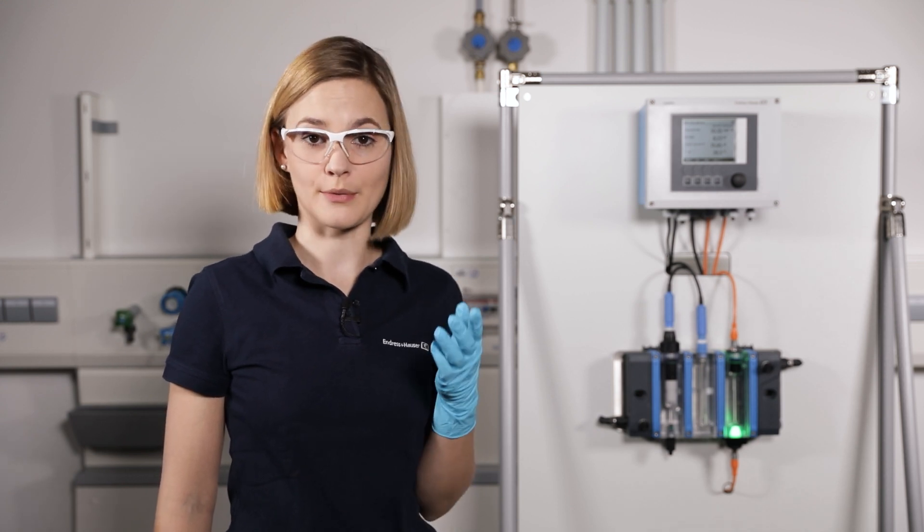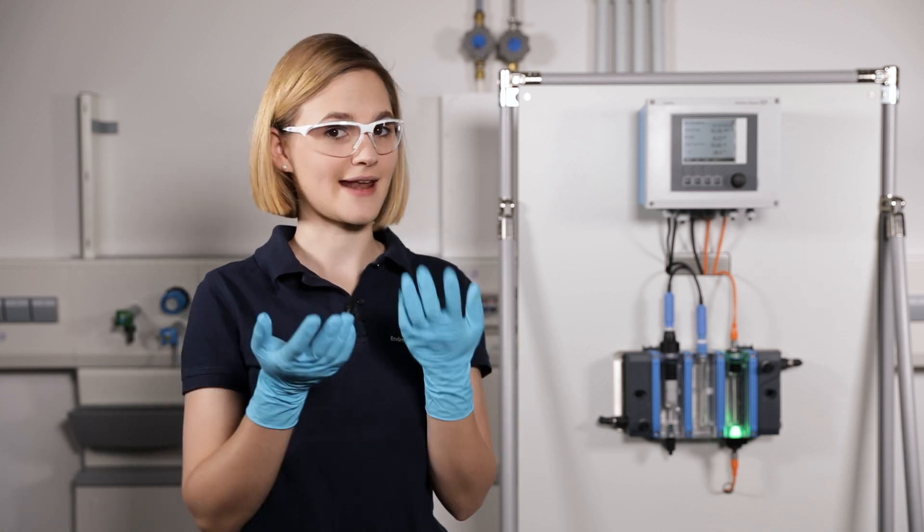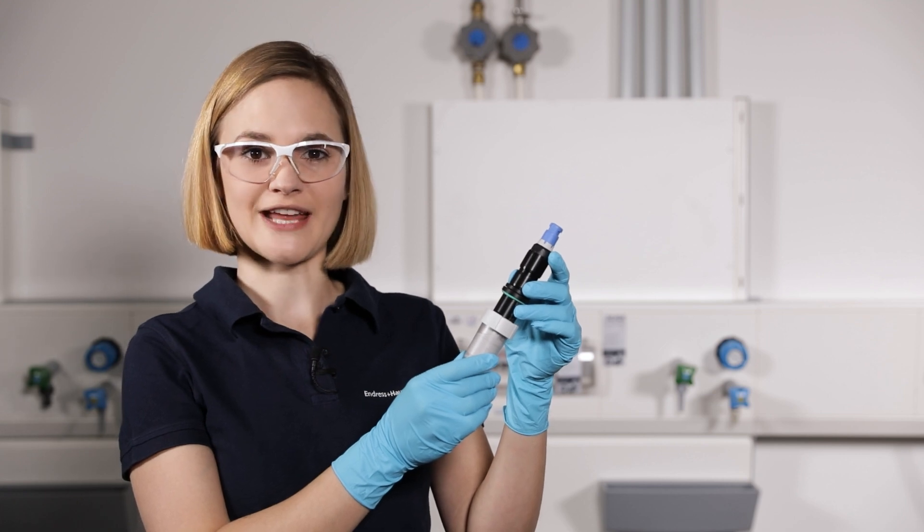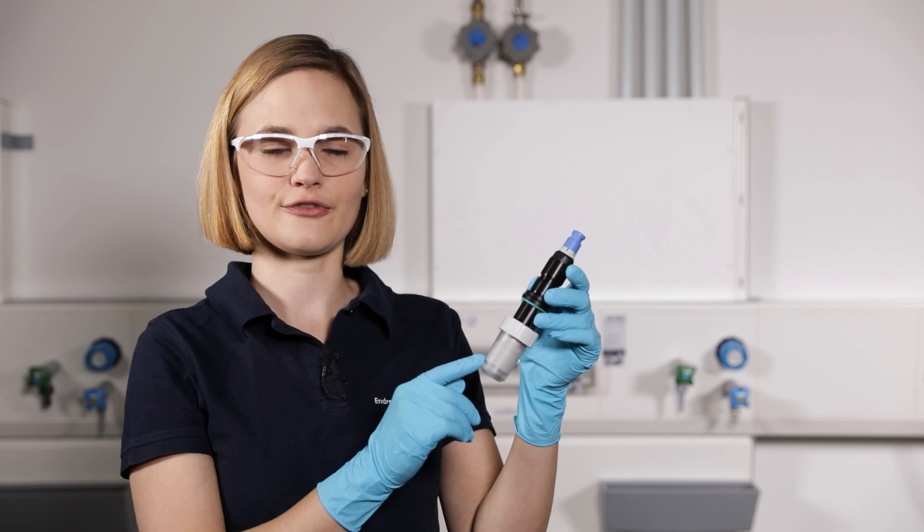Before installing the sensor into the process please remember always wear your personal safety equipment. Safety glasses and chemical resistant gloves. The sensor is fitted with the protection cap for best storage conditions. This cap has to be removed for commissioning.